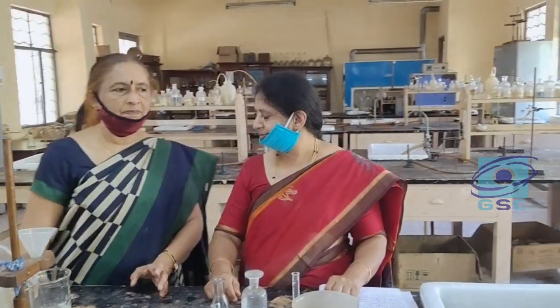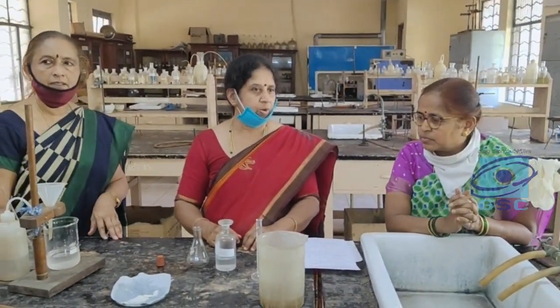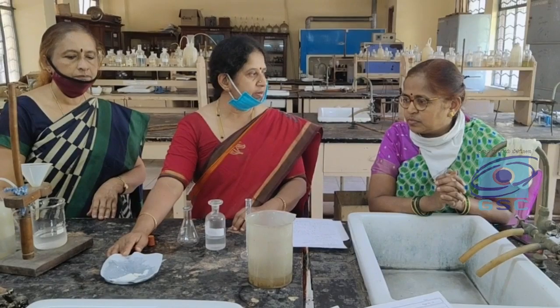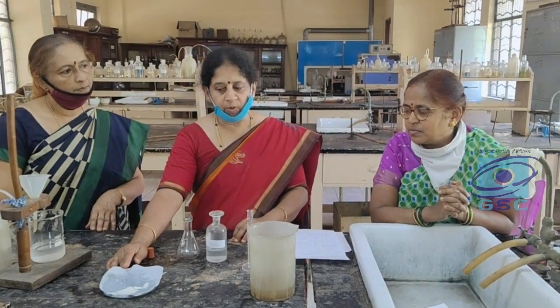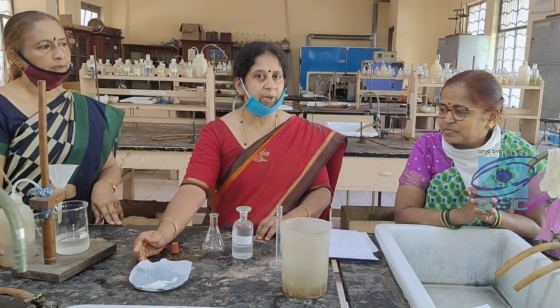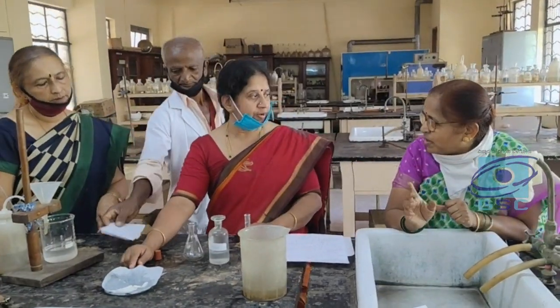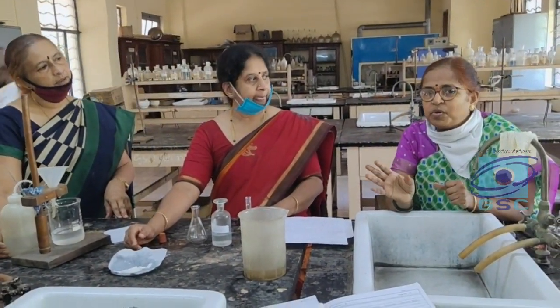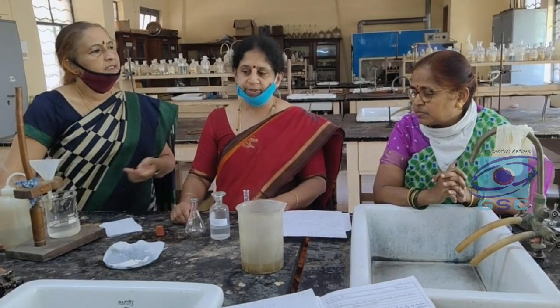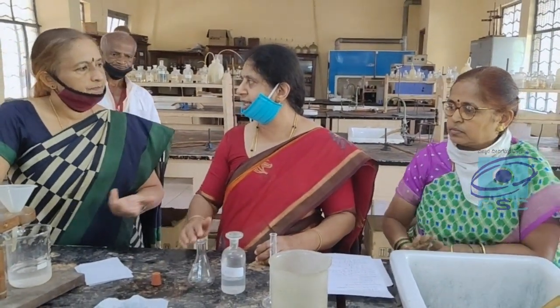What is the importance of recrystallization? Is it needed? Yes. As for any organic compound preparation, whatever product we get will be a crude sample — it will be contaminated with other by-products. So if you want to determine the melting point of the individual compound, we have to purify it. One method of purification is recrystallization. One method of identification is also to get a melting point. We have to purify it, and with the help of melting point we can determine which compound was prepared. We are using hot water as solvent because hippuric acid is soluble in hot water.